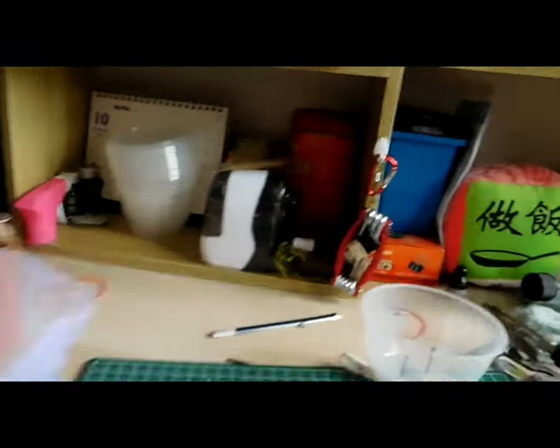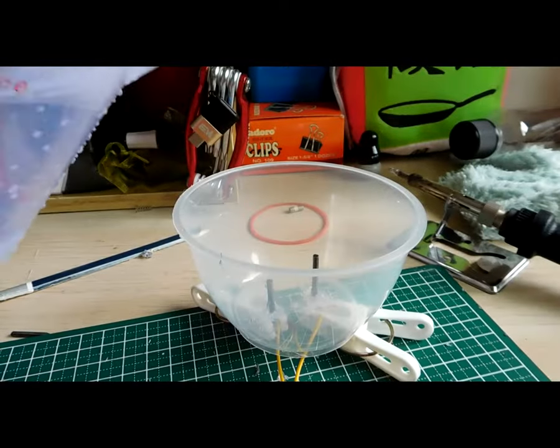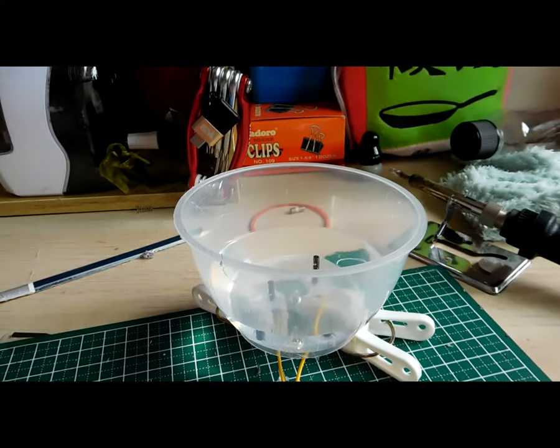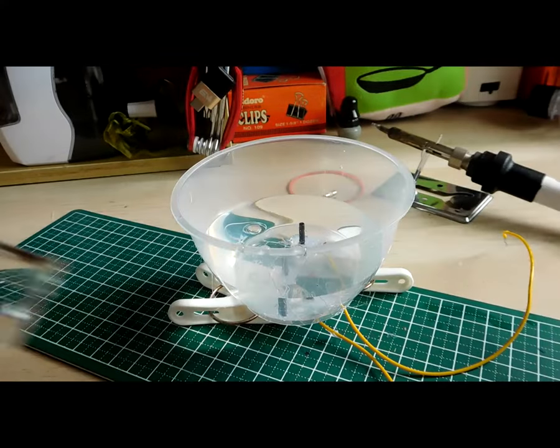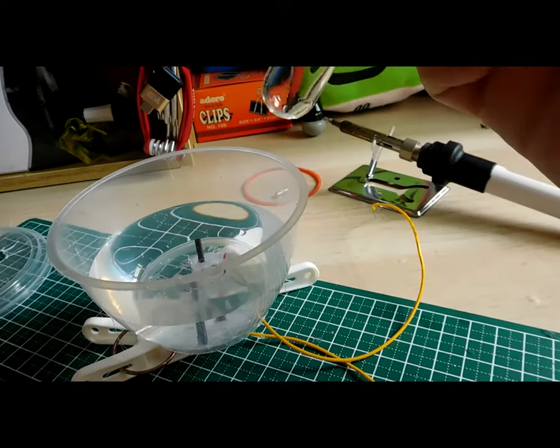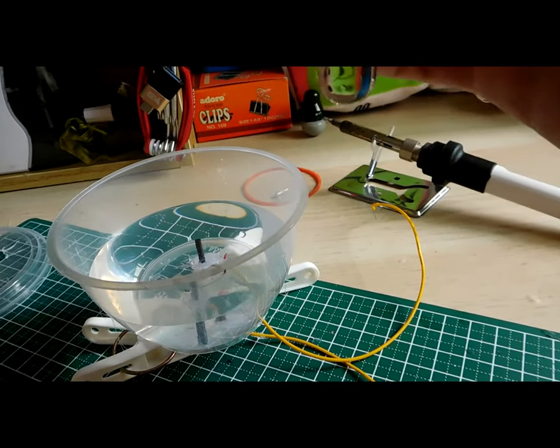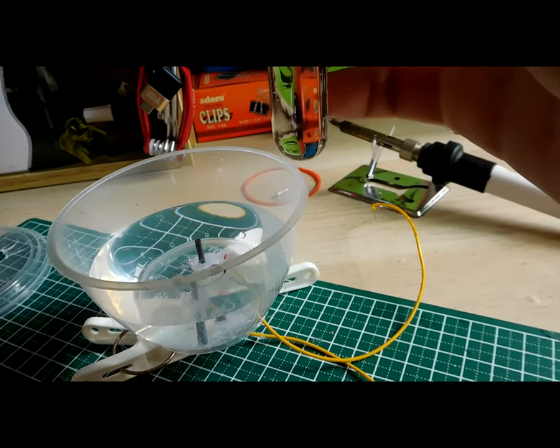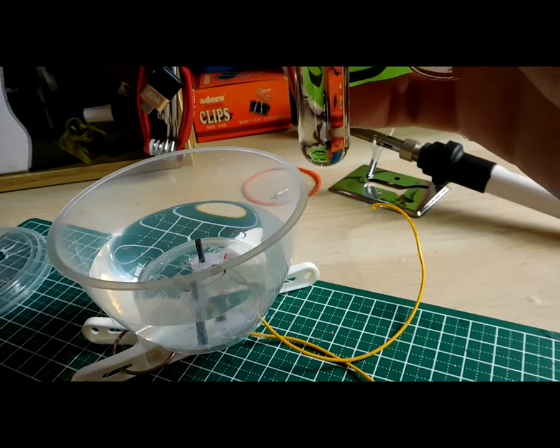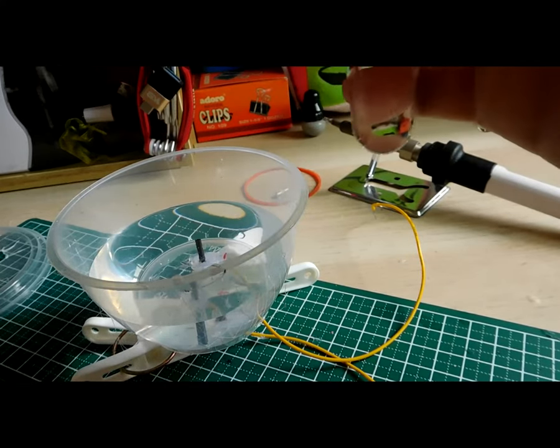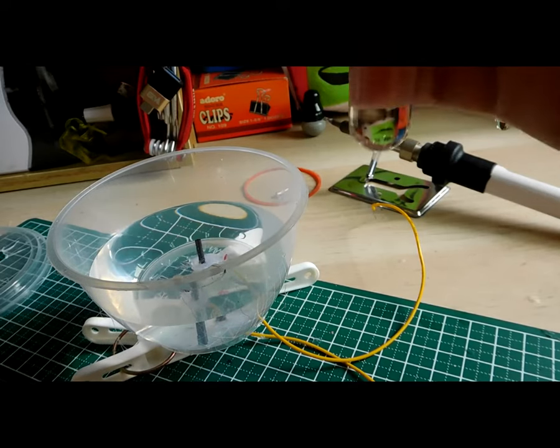I'll just get the water from here and fill this thing up. With my beaker half filled with water, I can use a pipette to pipette the water from the 1.2 liter beaker and fill it up to the brim of the two test tubes that are used to collect the two gases. The gases will displace the water, hence the displacement of water gas collection method.